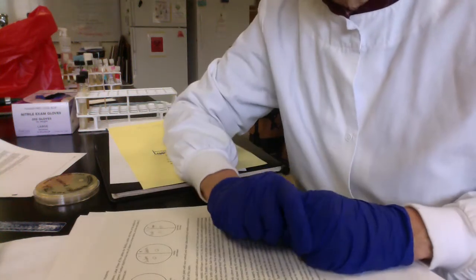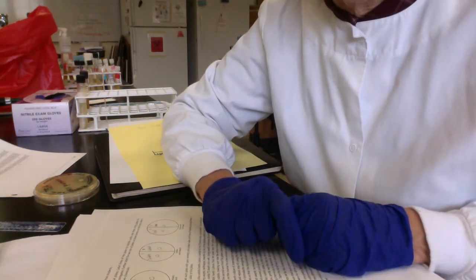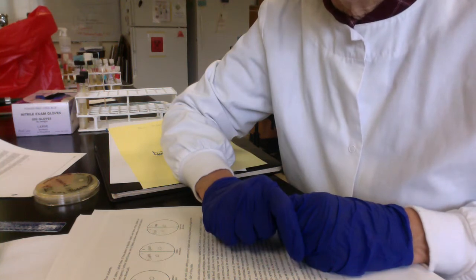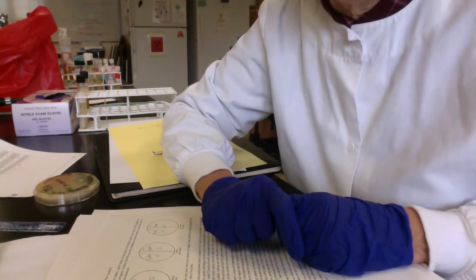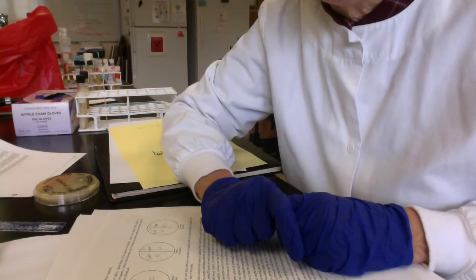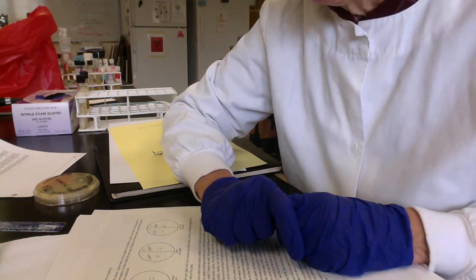Hi micro folks, this is March 17, 2020. This is a video discussing chapter 14 in our lab manual, Control of Microbial Growth, and we're going to talk about disk diffusion studies here.